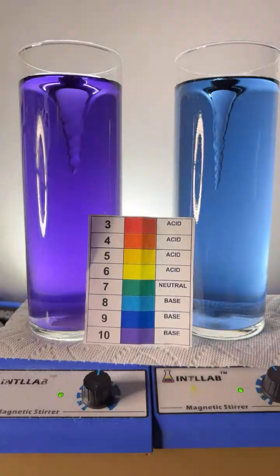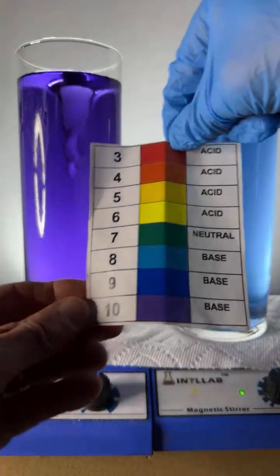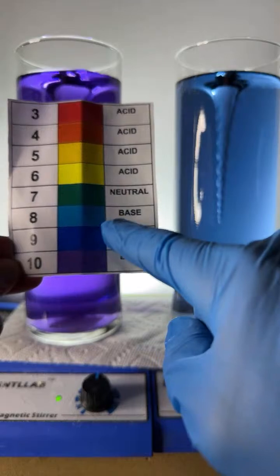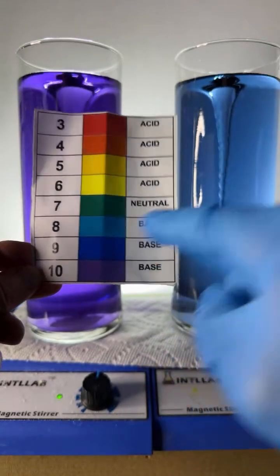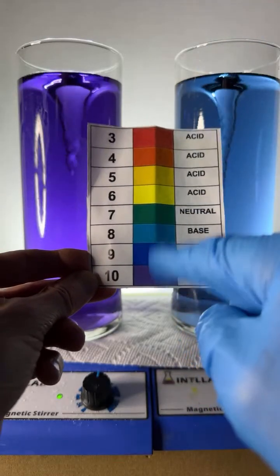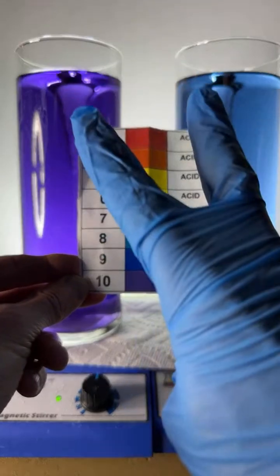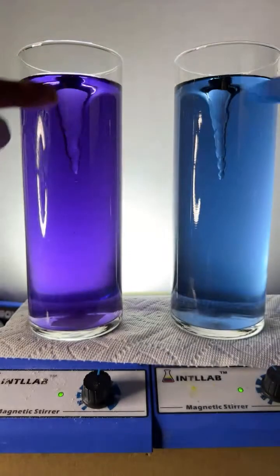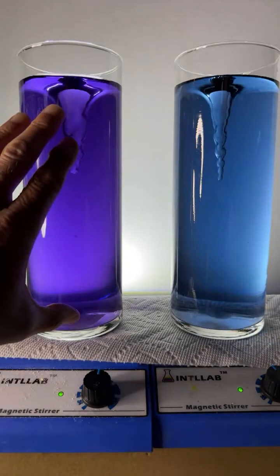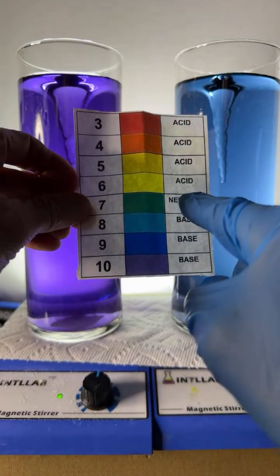So you can look at the pH scale right here. I'm going to turn on this light so you can see it a little better. This flask over here is pH 10, which is actually quite basic. This flask over here is maybe pH 8. Those colors match. This is much less basic because the pH scale works on powers of 10. The difference between 10 and 8 is 2, so 10 times 10 is 100. This is 100 times more basic than this. If I get it to green, that's going to be neutral, neither acidic nor basic.